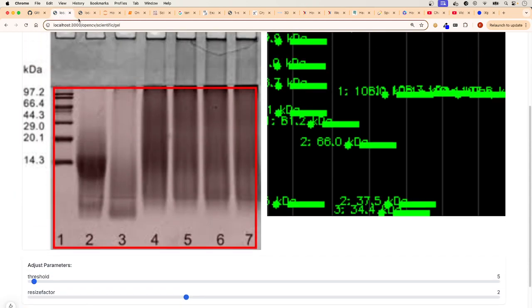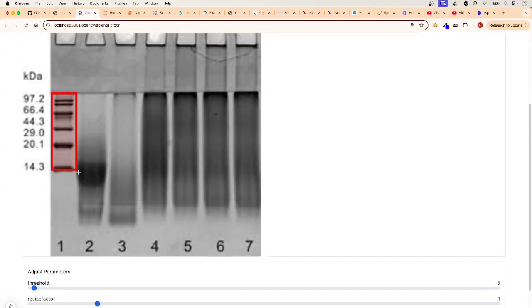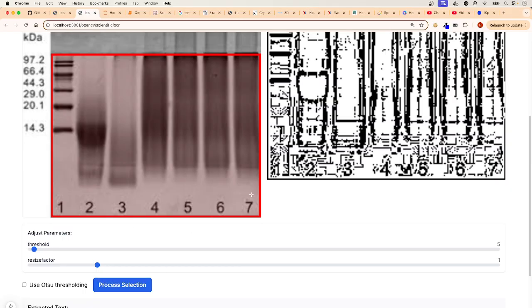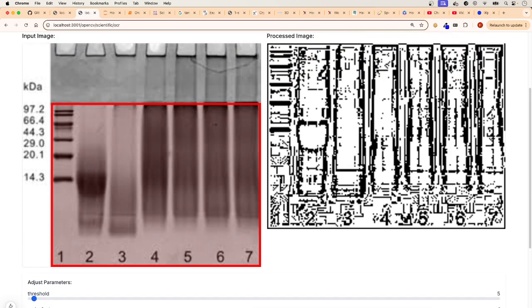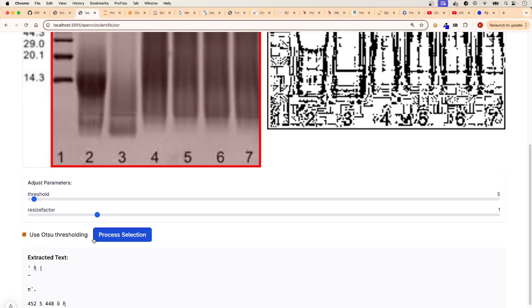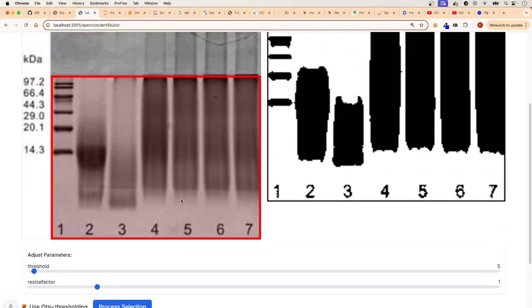Let's try ours. We got it ready, so might as well use it. So now let's create an area. I'm including the numbers for a reason. Let's do process selection. And there it is. If you're not using Otsu, it's going to give you a lot more noise because it's using the default. So once you use Otsu and then process the selection, you see that it changes, right? So that's what's happening here.